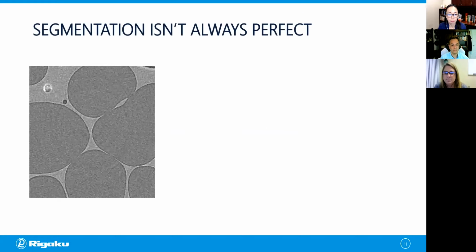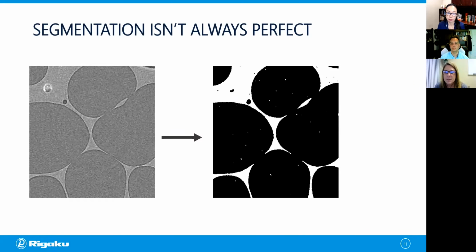To illustrate that, I'm showing a figure here of a foam sample, and thresholding is used to segment this particular image. In this case, we assign polymer pixels as white and void pixels as black. If we look at this, we can see that there are incorrectly assigned pixels. Specifically, in the polymer area, we have some pixels that are labeled as void, so they're false positives for void. And inside the void, we have some white pixels labeled as polymer, and that's a false negative. So we need to refine these results.